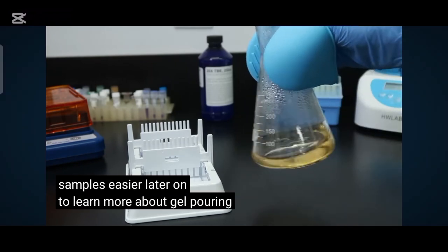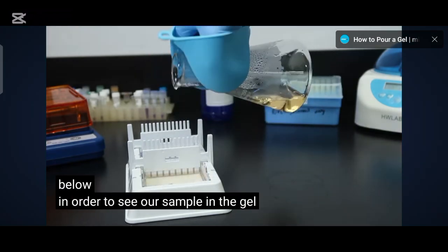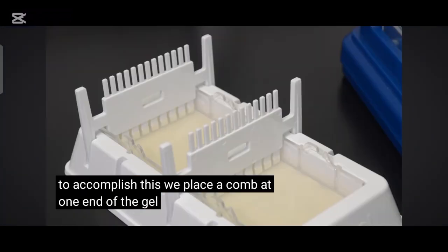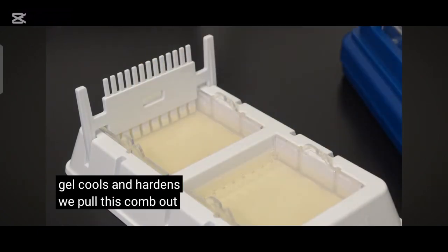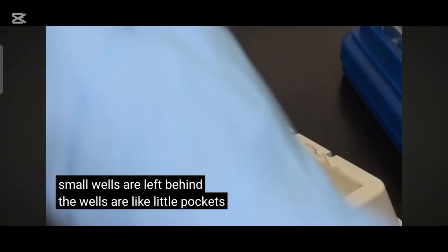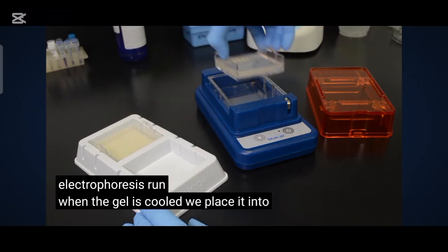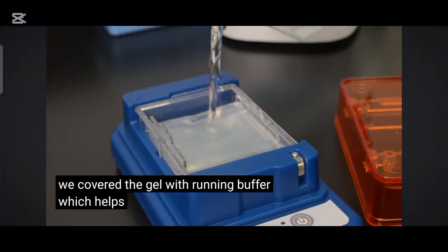To learn more about gel pouring, you can watch our How to Pour a Gel video linked below. In order to see our sample in the gel, we first need somewhere to add the DNA. To accomplish this, we place a comb at one end of the gel. When the gel cools and hardens, we pull the comb out and small wells are left behind. The wells are like little pockets in the gel, and they are how we put our DNA into the gel at the start of an electrophoresis run. When the gel is cooled, we place it into a gel electrophoresis chamber and cover the gel with running buffer, which helps conduct electricity.